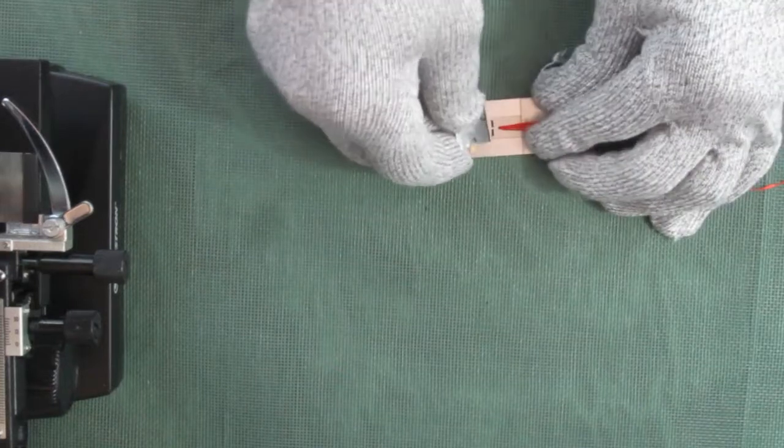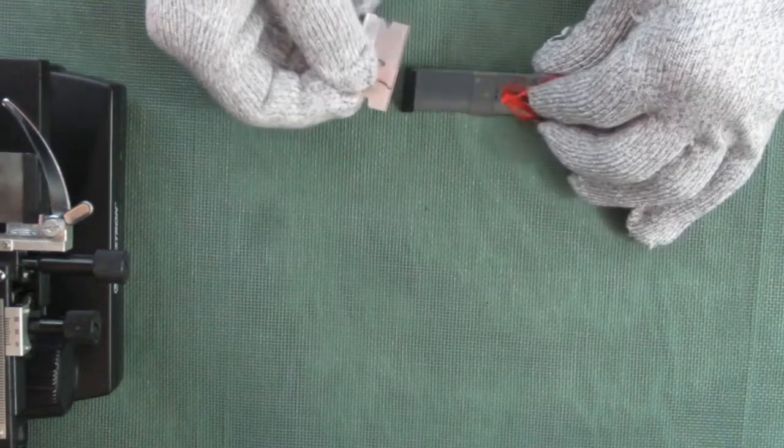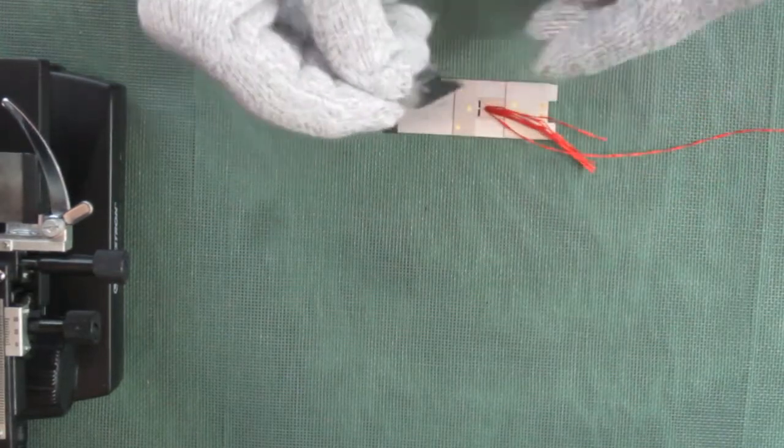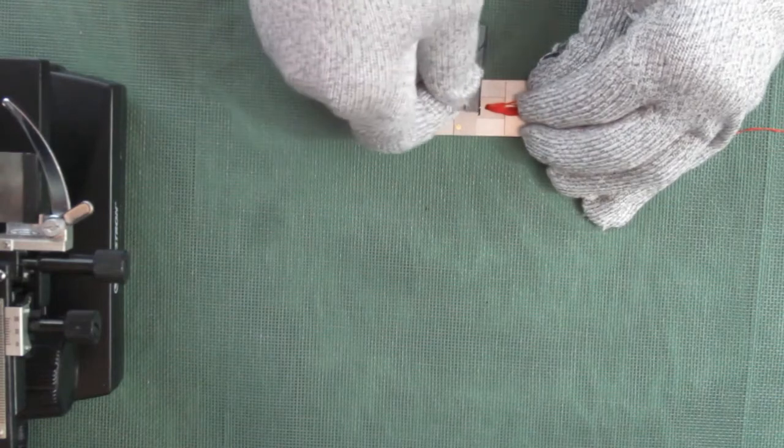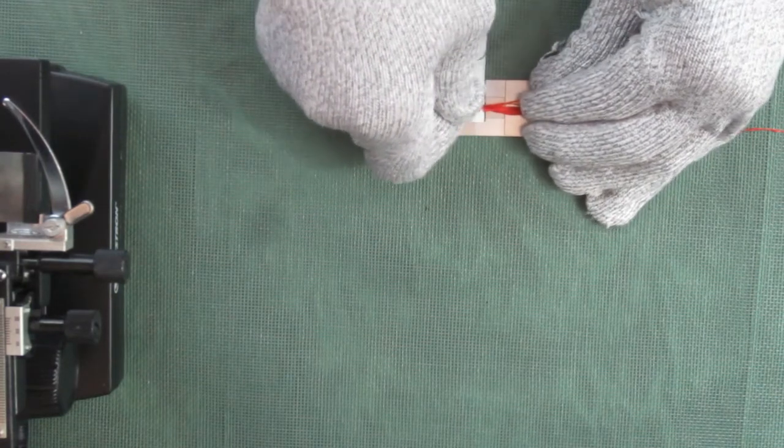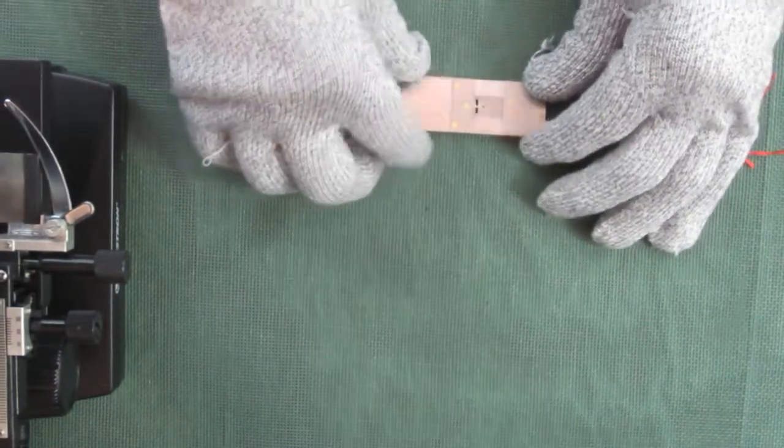Let me set it down. We'll go ahead and take a cut. As we flip the part, we will flip the razor blade. Take the second cut, and there you go, that's it.